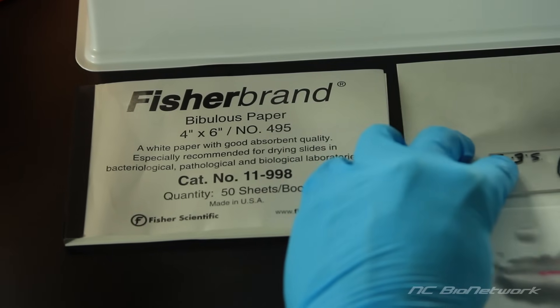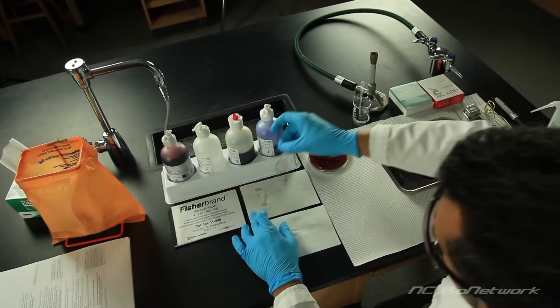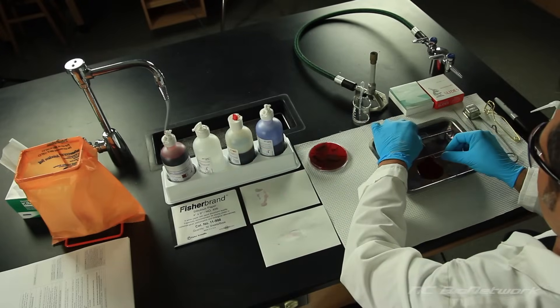Use bibulous paper to gently blot the slide dry. After the slide has completely air dried, the smear will look like a thin red haze.